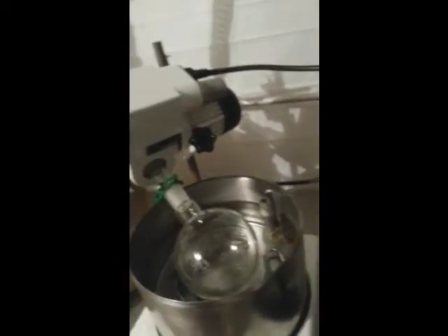I got a leak that's in the gauge or something. I'm going to have to check this out. I'm leaking over here a little bit. That's why it's not holding. But over here, let's see if I go... Did I pinch this all the way off? Right there. Pinch the vacuum off and see what I get.